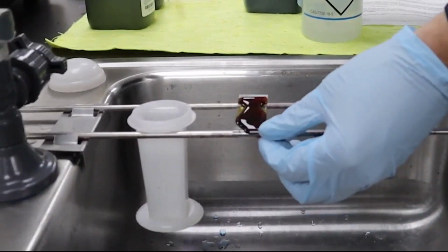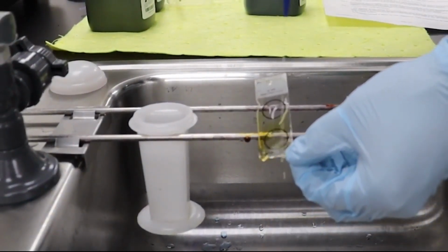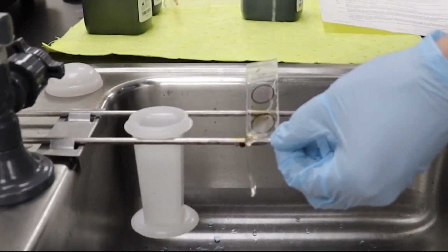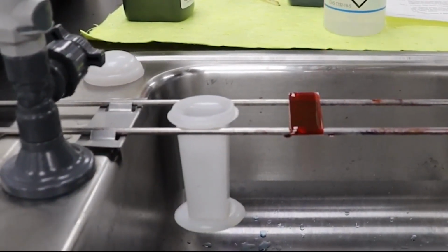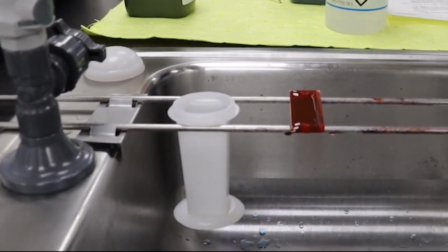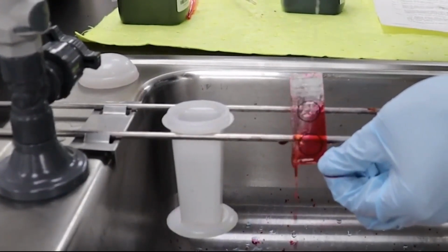When possible, avoid using a spray bottle as seen in this video because an intense stream of water might loosen the sample and cause it to fall off the slide. We suggest running the slide in gently running tap water instead. ELITechGroup combines the decolorizer and counterstain into a single efficient solution. Apply the decolorizer for 20 seconds for thin smears. Again, we suggest rinsing in gently running tap water instead of a spray bottle when possible.